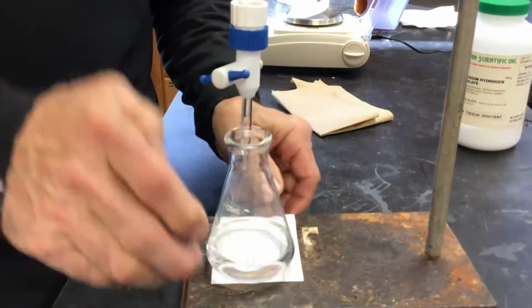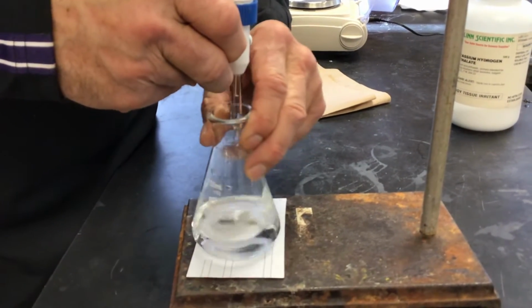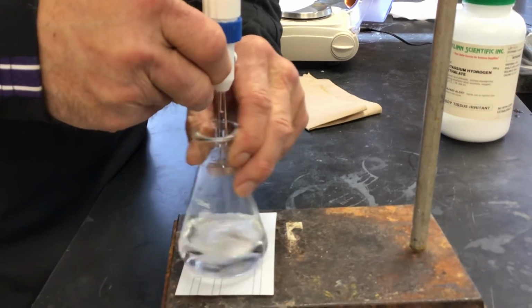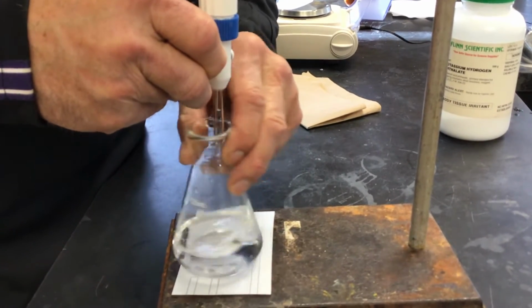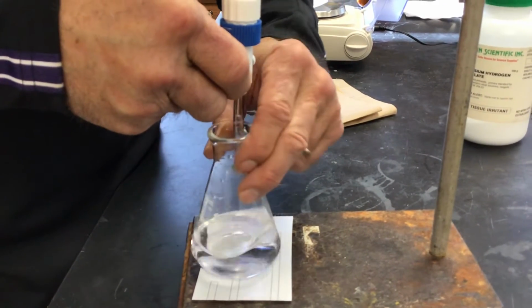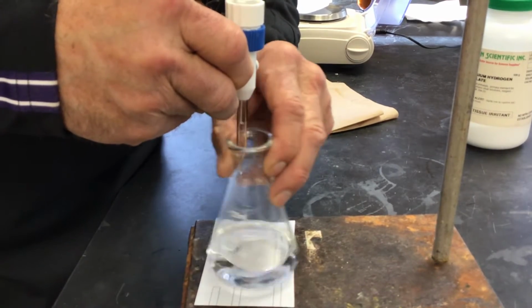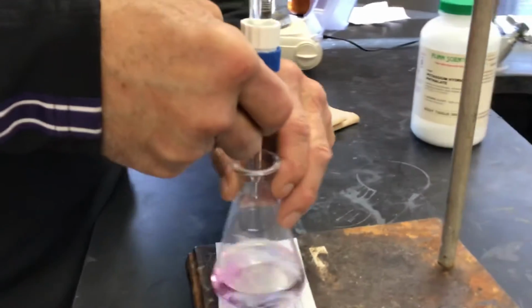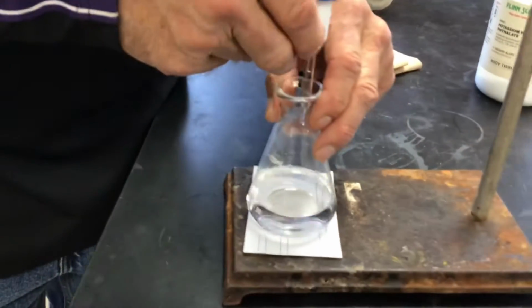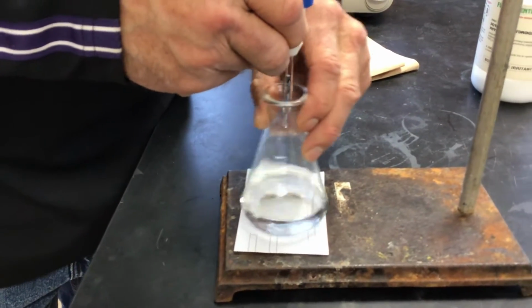Students, we'll just wake you up when we're all set with this trial. Yeah, it looks like we're close. Gotta be. Still disappeared. Yeah, you're over 9.5. So that fast sloppy one we took about 10 milliliters. So we are close.